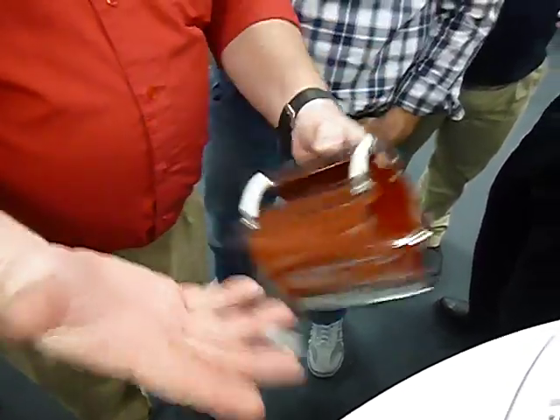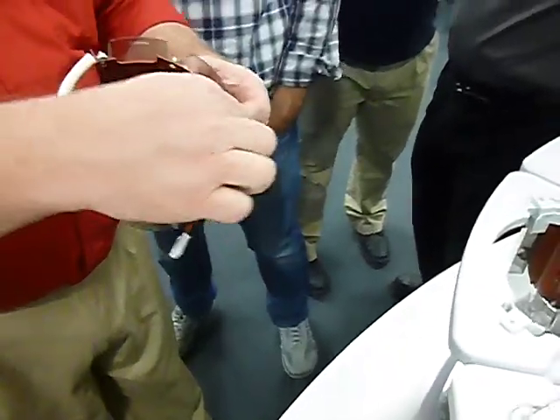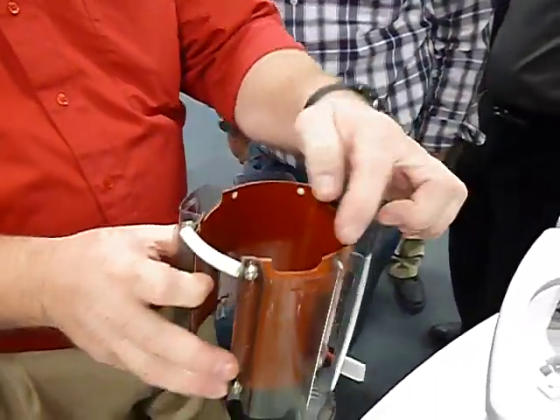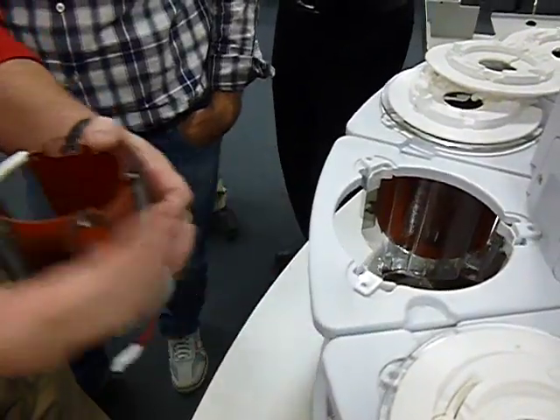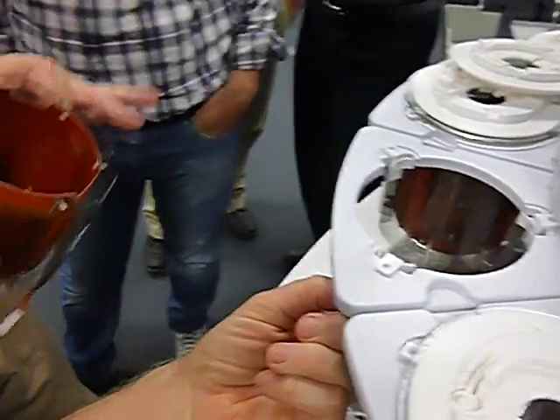You don't have to take them off to inspect them, but when you're inspecting up there, make sure none of these are cracked. These have a tendency to crack with misuse and not hold it up in place, because all it does is simply these hang on these, the bottoms of these, hangs it in place. So that's all you're checking for is the integrity of this. Make sure that it's not cracked and broken and doesn't need to be replaced.